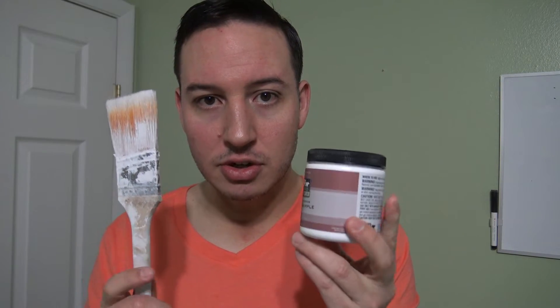I recommend taking about three samples per room. Repeat the process accordingly. Step 9 — very important: grab a paint sample from Home Depot (any paint, just a couple bucks), use a paintbrush to apply a thick, thorough layer of paint over wherever you took the sample from. This seals the area back off so you don't have to worry about asbestos exposure in the days to come. Once done, throw the paintbrush away in the trash bag.